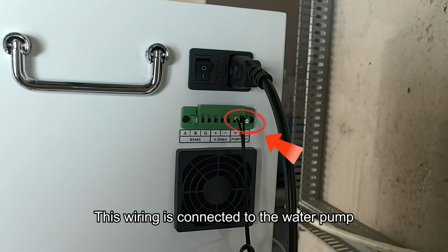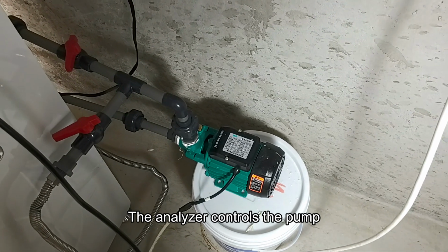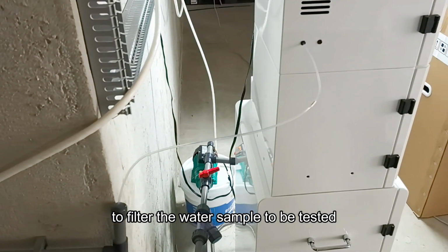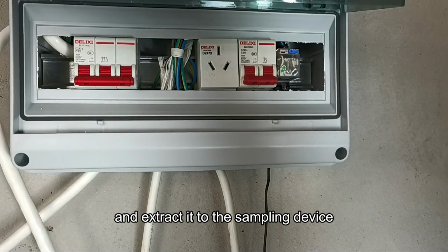This wiring is connected to the water pump. The analyzer controls the pump to filter the water sample to be tested and extract it to the sampling device.